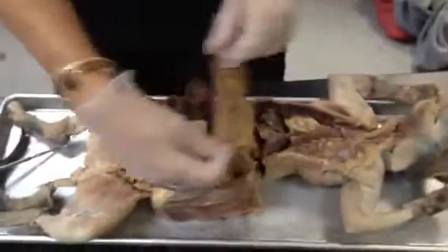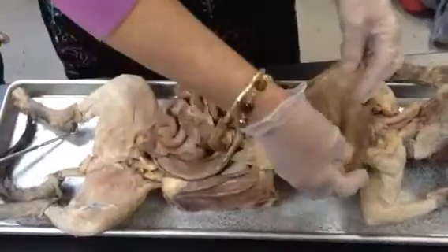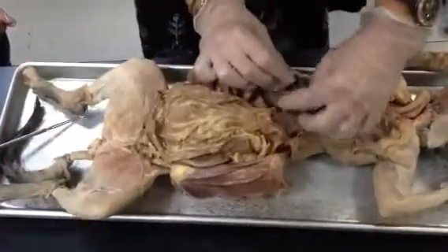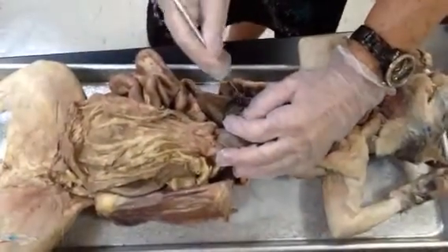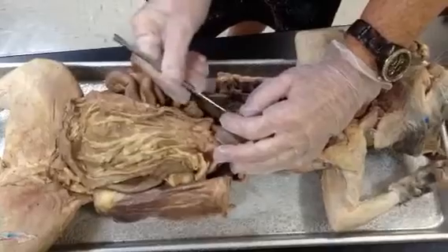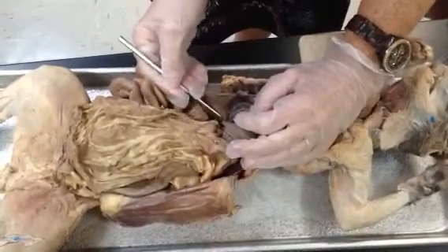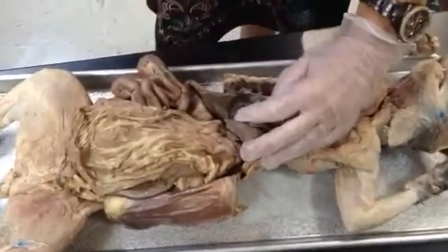All right. So you know what this is now, right, Jordan? The omentum. Okay. All right. So gallbladder was number 10. Now gallbladder is going to be here in between these two lobes of the liver. You see that little grayish looking sac? When it was full of bile, it looked greener. That's your gallbladder, and you can see how it runs down in here, the ducts. In between the liver and then the gallbladder in between two of those lobes.